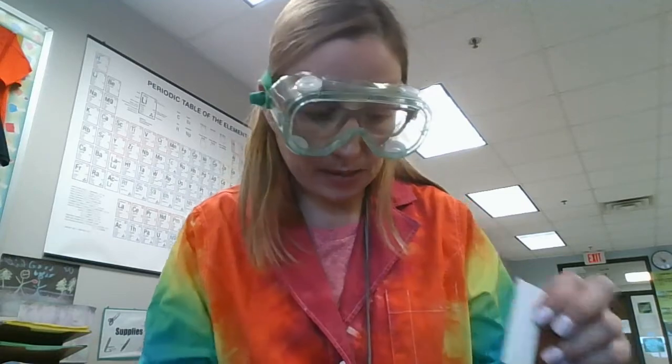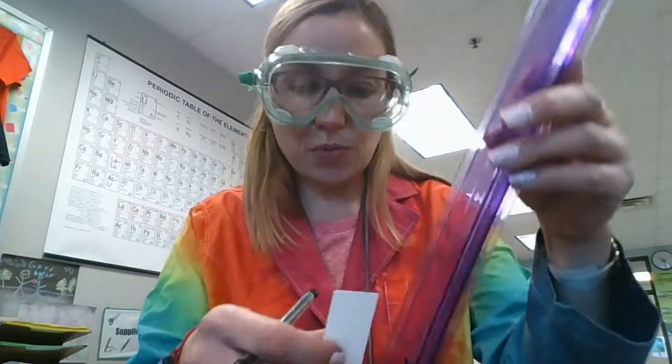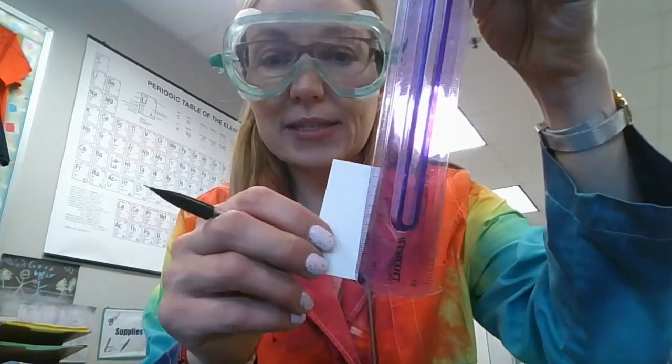So you're going to grab a TLC plate and you want to make about a one centimeter mark on the plate. What you want to do is go about a centimeter up, get your ruler, measure about one centimeter and make a line, and make it nice and straight.